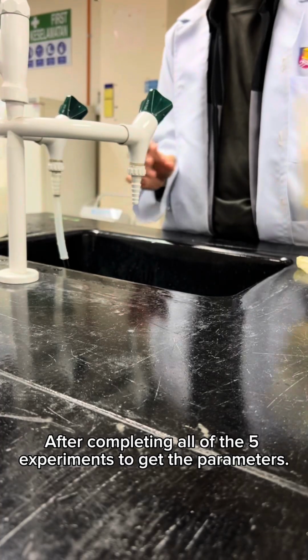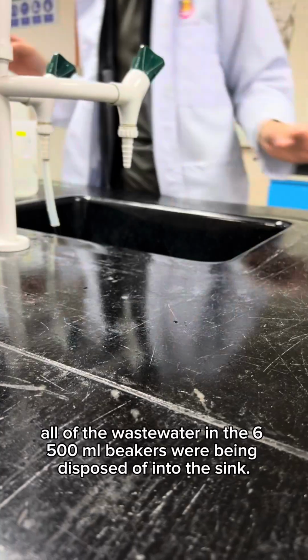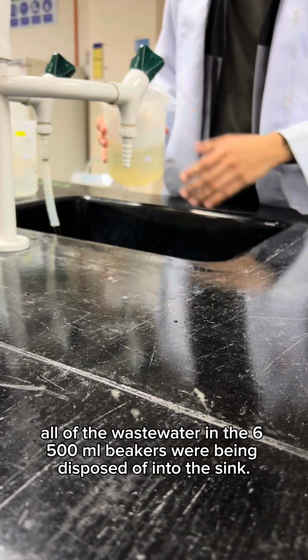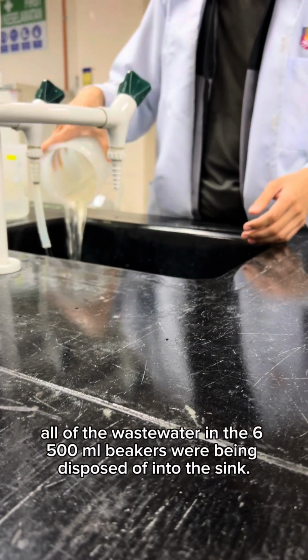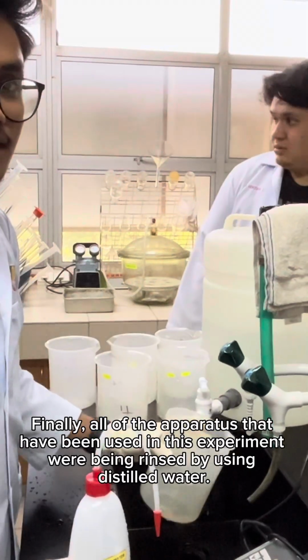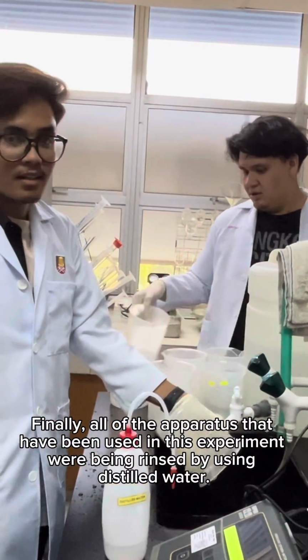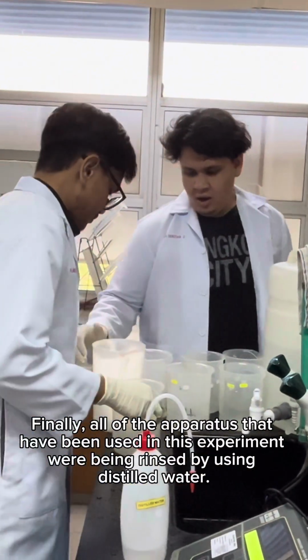After completing all of the five experiments to get the parameters, all of the wastewater in the six 500 ml beakers was disposed of into the sink. Finally, all of the apparatus that have been used in this experiment were rinsed by using distilled water.